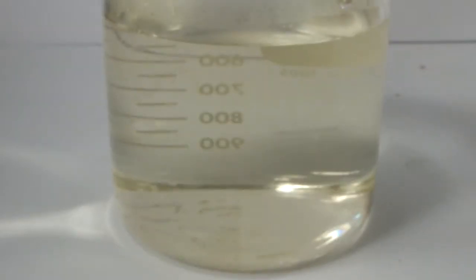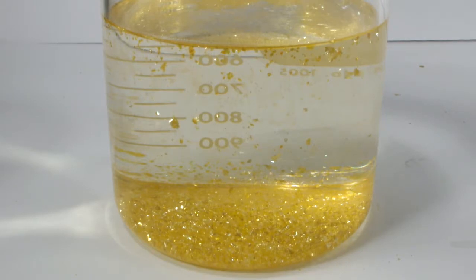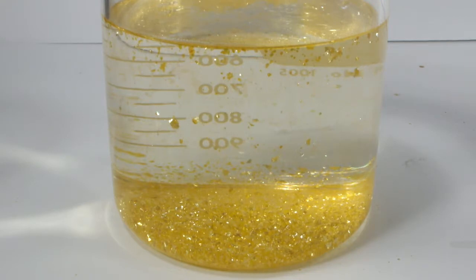Eventually, after an hour of boiling, I gave up, filtered off the undissolved product, and left this to cool for a while. After another half hour or so, I wasn't disappointed. The crystals form slowly, and they float to the bottom as what is typically called golden rain.